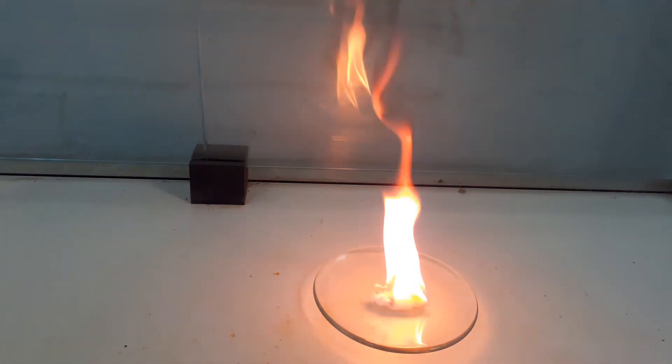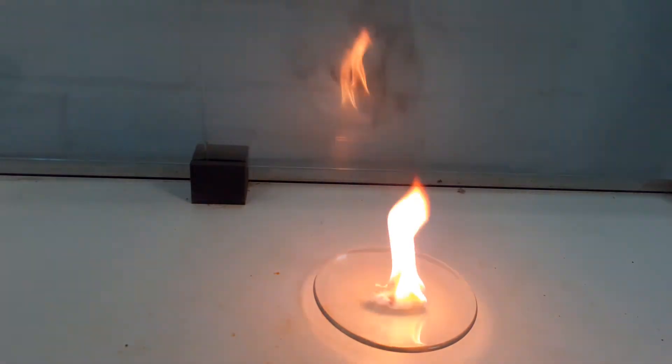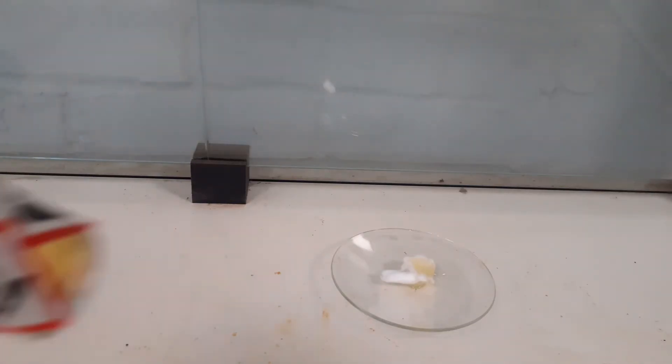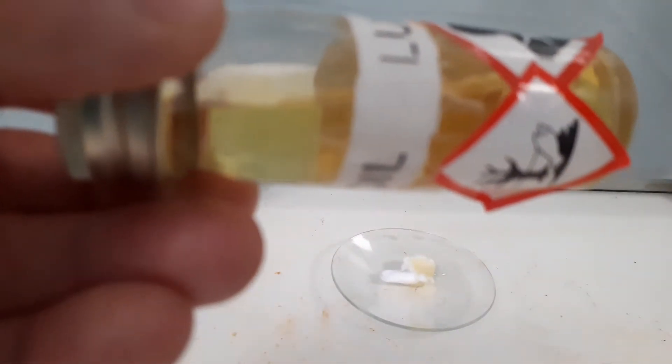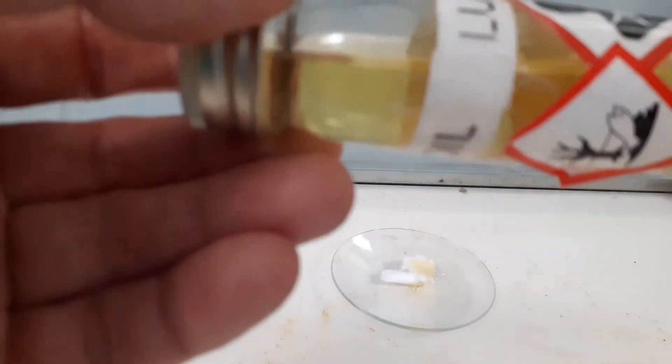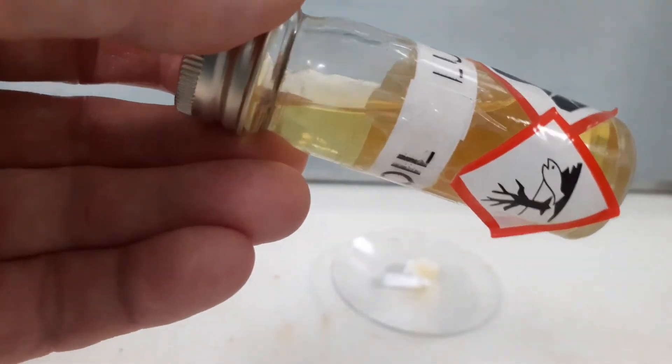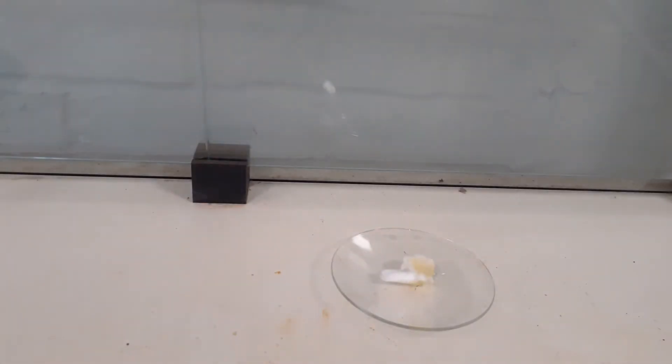Next up is lubricating or ship oil, a very thick oil. You can see darker again. And again because the molecules are longer, so there's greater chance of them getting entangled with each other.